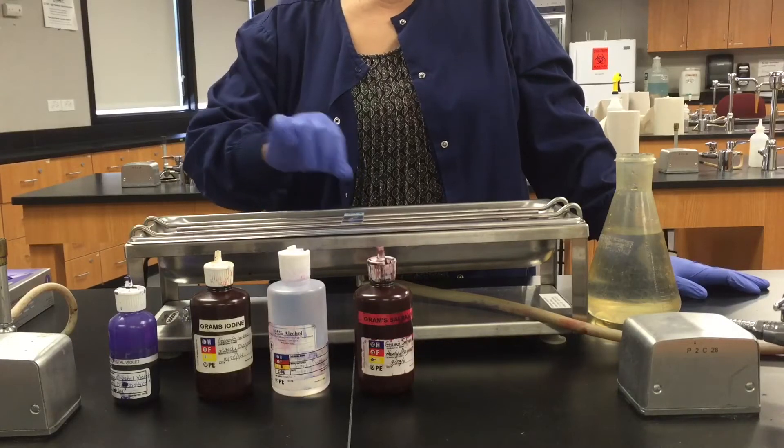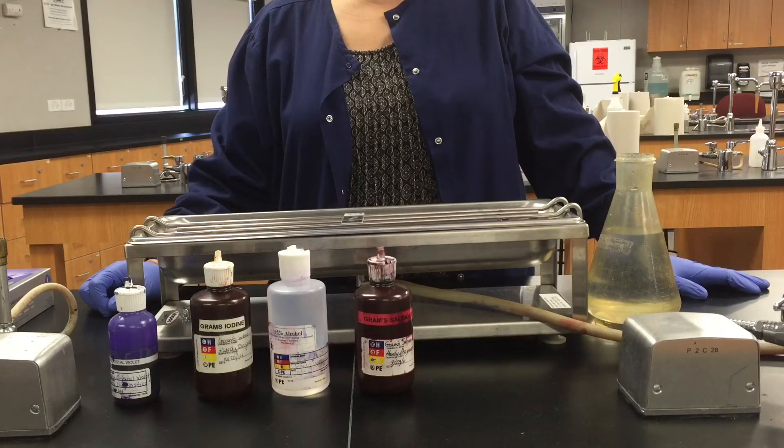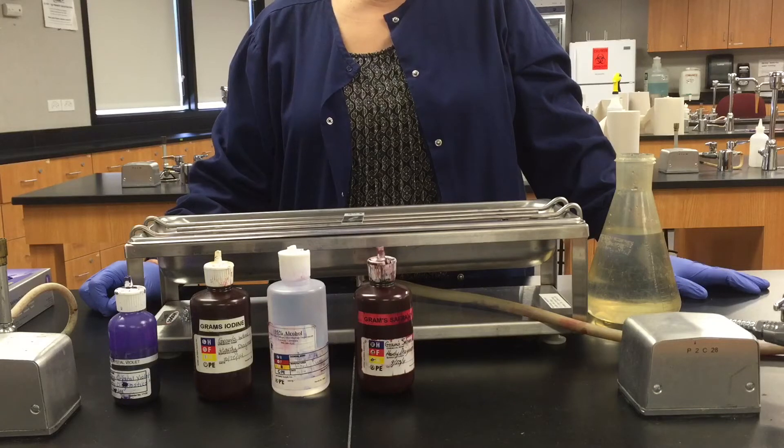You might review that video in your lab manual. Now Renee is doing the stain over what we call a staining bench or staining rack. You'll do this over the staining rack in your sink. This is just a nice portable contraption for making stains.